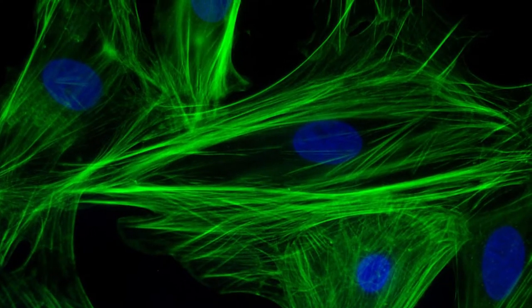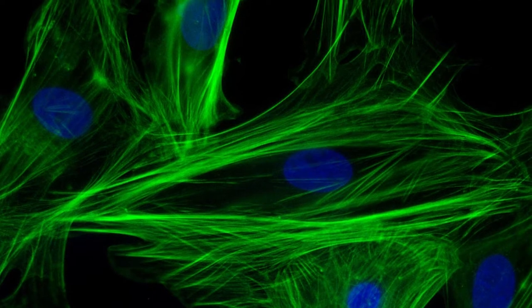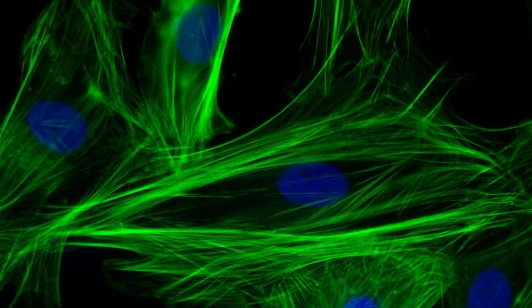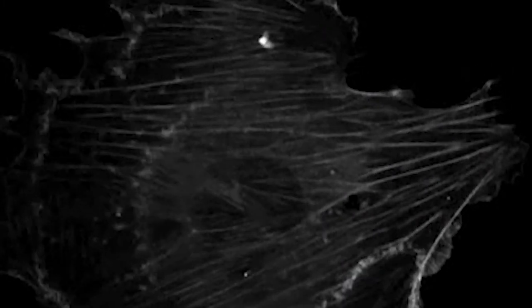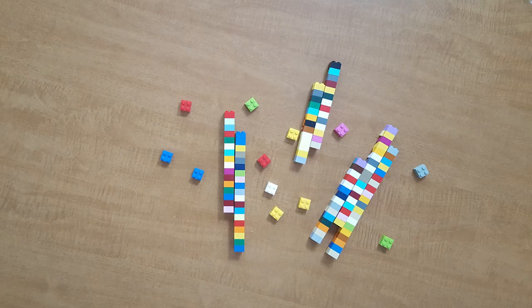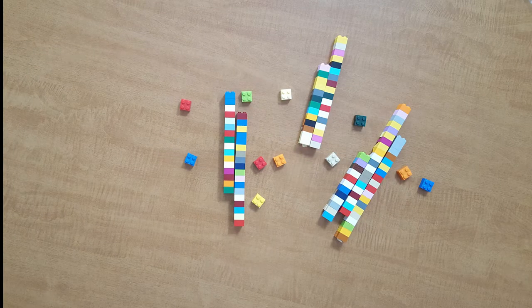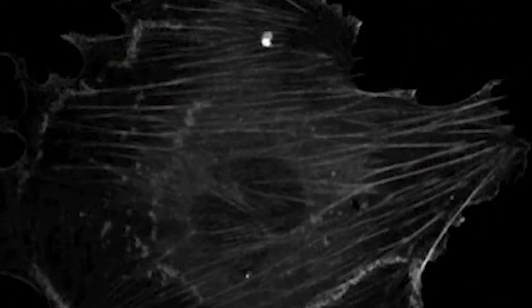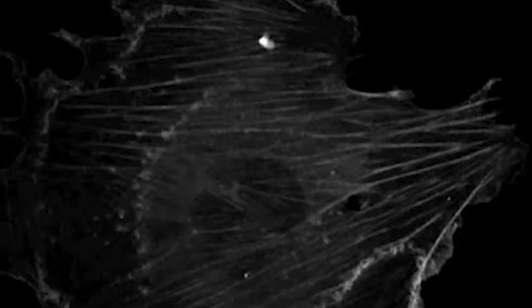These green lines represent many, many individual actin proteins, all stacked together into long actin filaments. The problem is, when scientists take a picture, or even a movie, of a live cell like this, you can't tell whether the proteins are stuck in place, or if they're rapidly exchanging with other proteins in the cell. That's because individual proteins are too small to see under a light microscope, so we can't tell if individual proteins are moving or not from a movie like this.